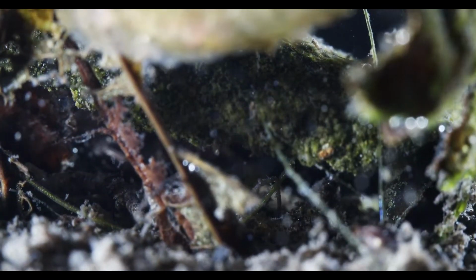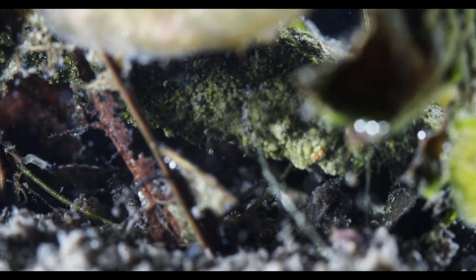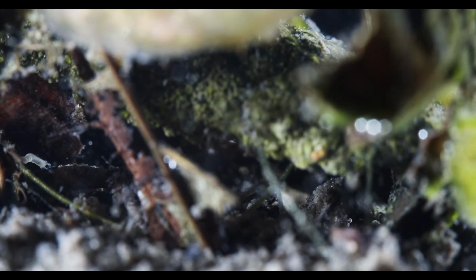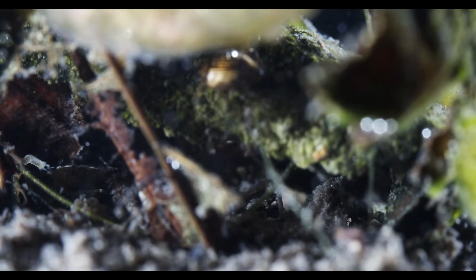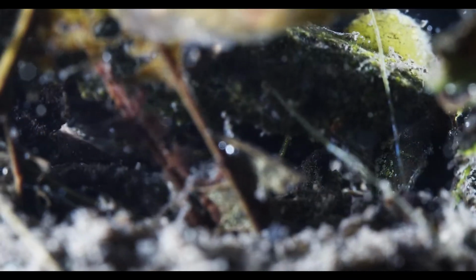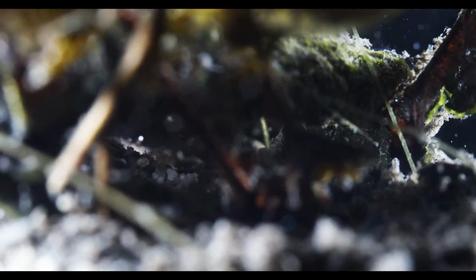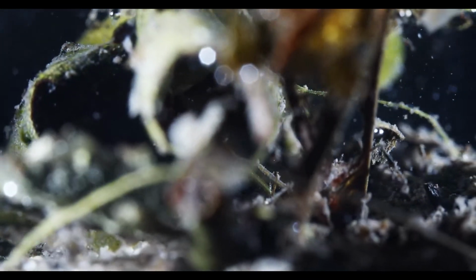Glad you're here. What is that? Is that a Hydra? On the left there? Now it's in the light. Looks like a messed up Hydra, kind of. It isn't moving, so... I know there's a planarian here also. Don't know where he's hiding. Maybe somewhere down here in the shadows. Not sure.